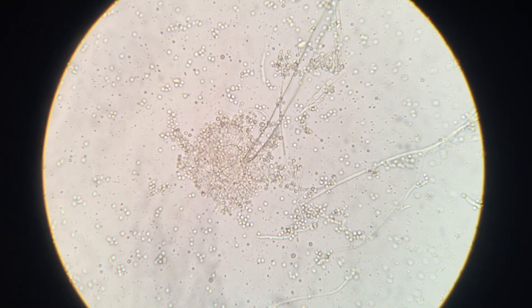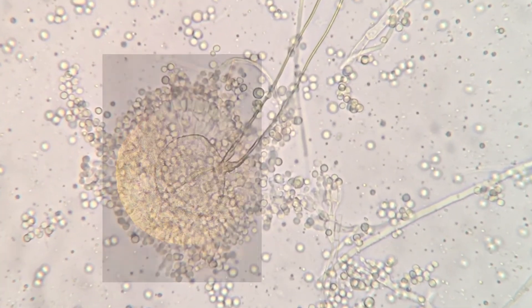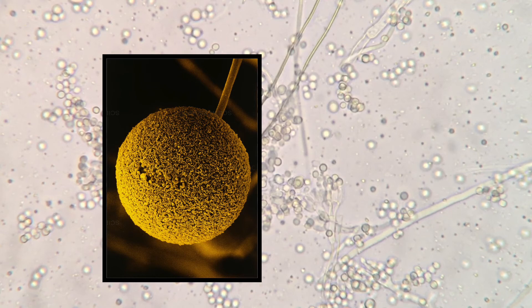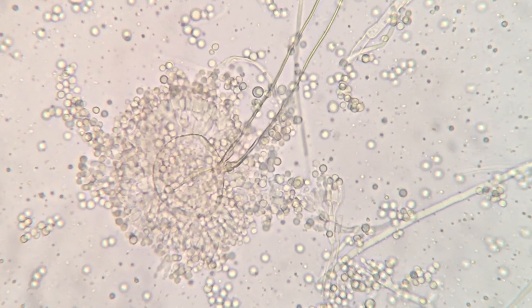I did find an electron microscope view, and this is what it looks like for the sporangium — and again that spreads the spores. And that was bread mold underneath the microscope.